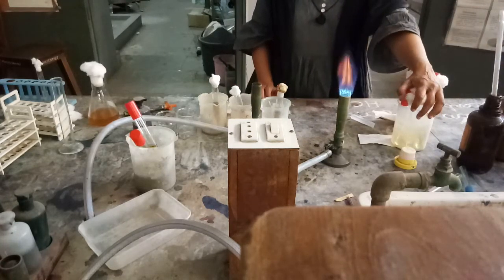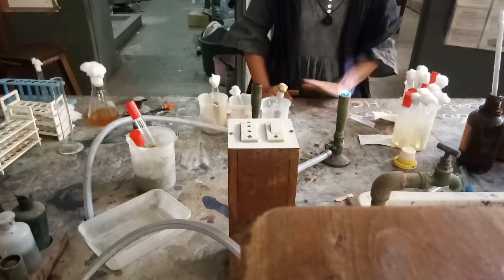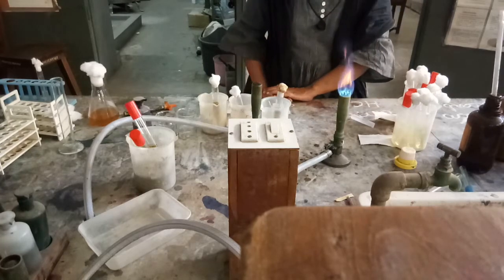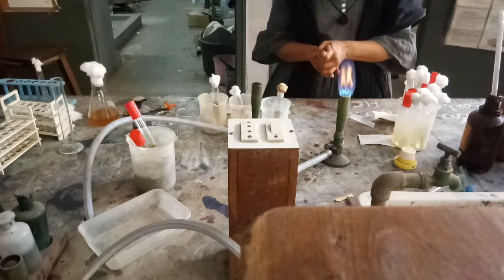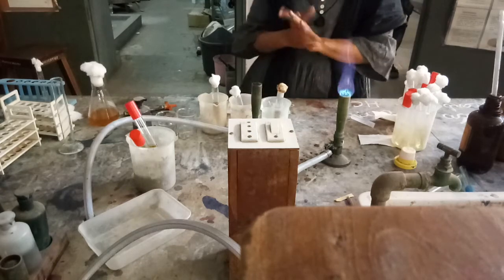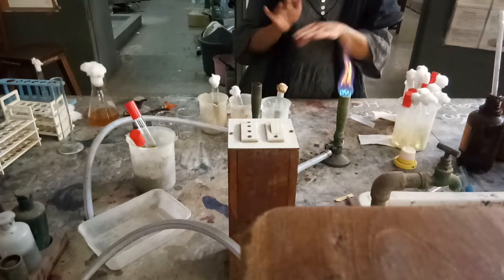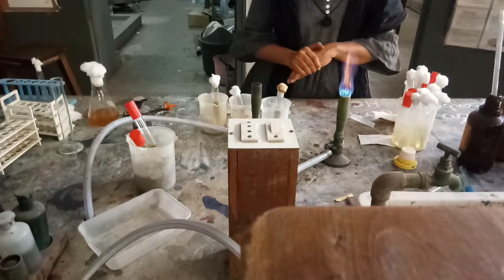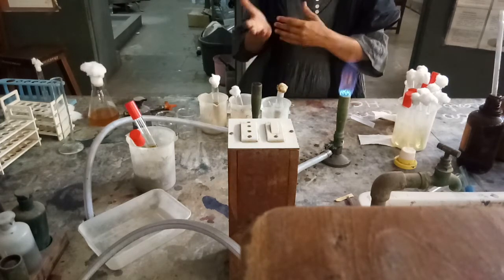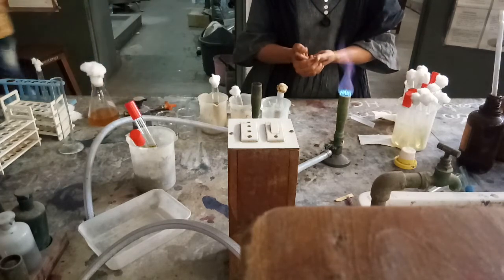Anaerobic bacteria will be found in the thioglycolate broth, and aerobic bacteria will grow in the soy bean casein broth. In soy bean casein broth, we can get two different types of organisms — bacteria as well as fungi. If it is kept at 27 degrees centigrade or lower, we will get growth of fungi; if kept at a higher temperature, we will get growth of bacteria.